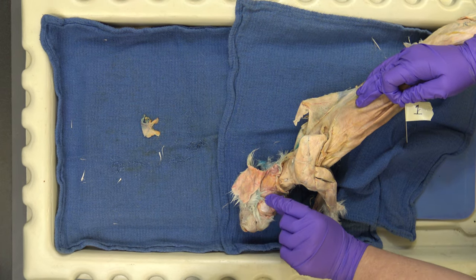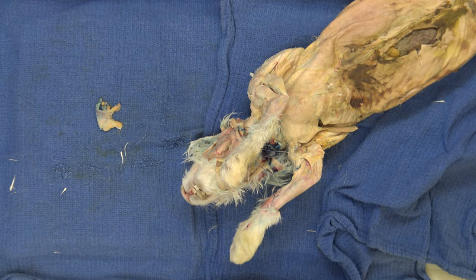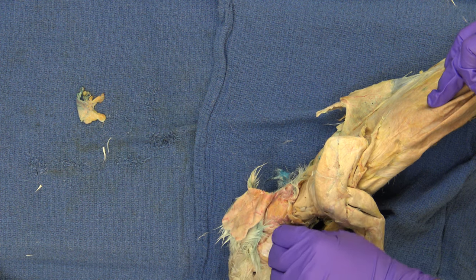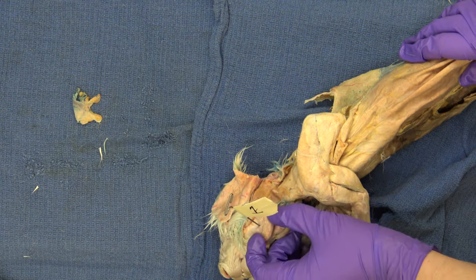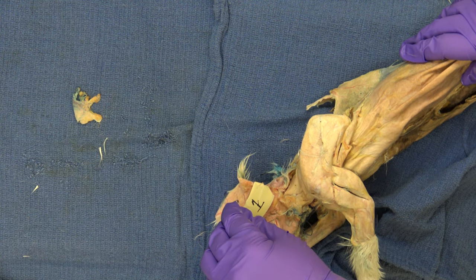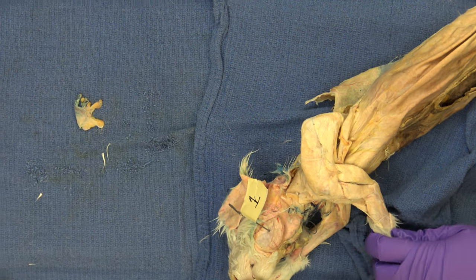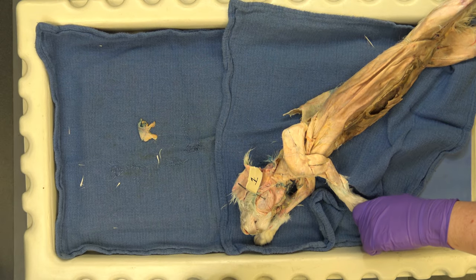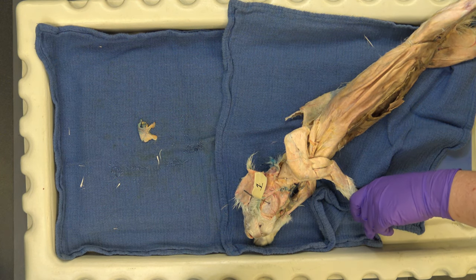You can actually feel your masseter when you grit your teeth — it's your cheek muscle, and this is the muscle for grinding. When you're grinding, shutting your jaw, so there we go — masseter. For the lab exam, you're going to need to know just the identification, but for a couple of them I might ask you what the function is, where it originates, and where it inserts. I'll go over some of those as we go through here.